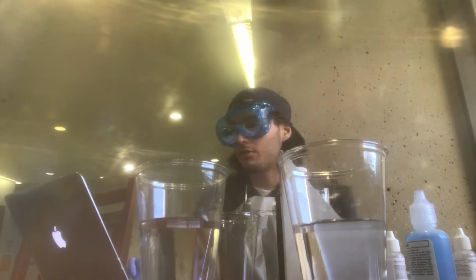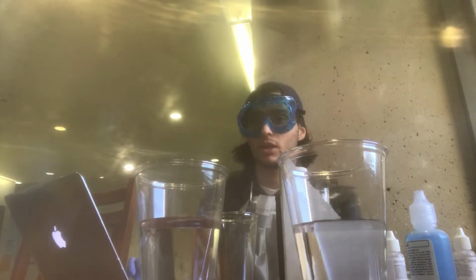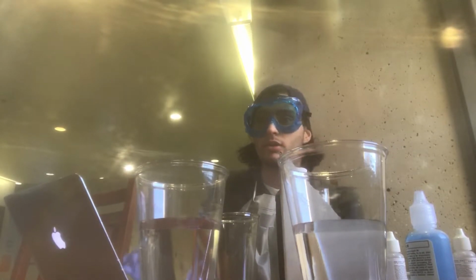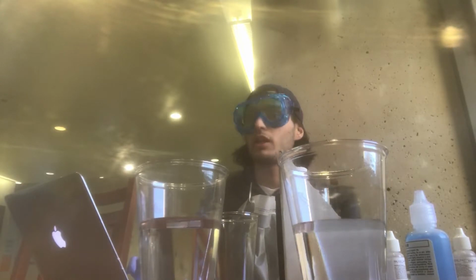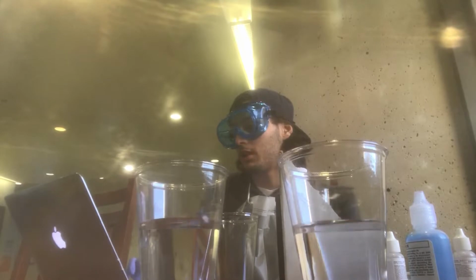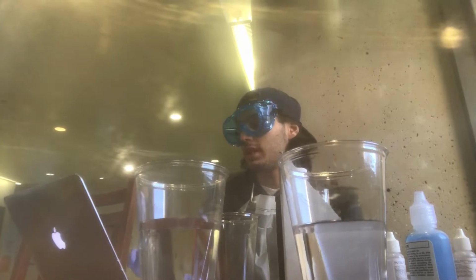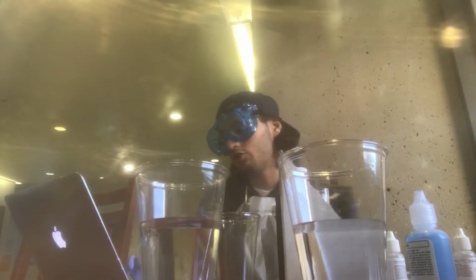So there are a lot of different things that come into play whenever you're doing the iodine clock experiment: the different temperatures, the different concentrations, the physical state of the matter. All these things are very important, and they all affect the rate of the reaction. Some can slow it down, and some can make it a lot faster. So that's pretty much what a catalyst is. A catalyst is a substance that increases the rate of a chemical reaction, but is not chemically changed during the reaction.